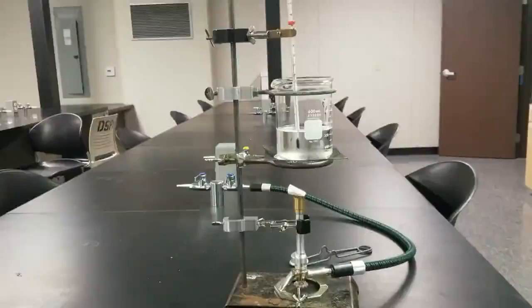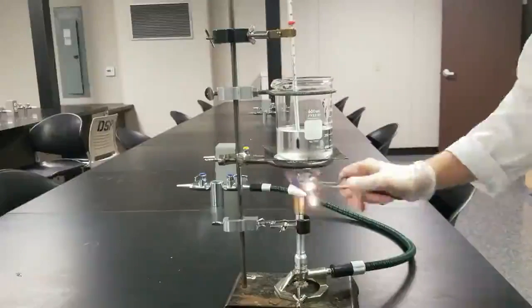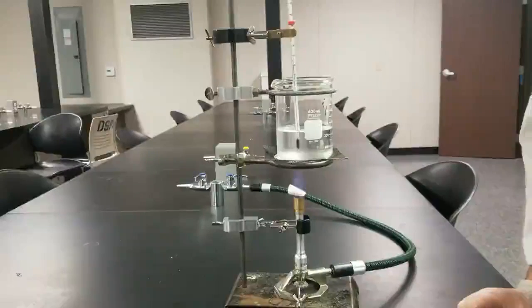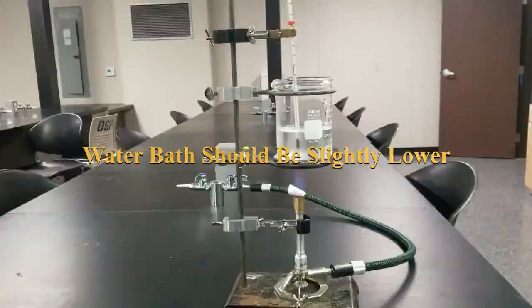Next up, we want to heat our water to a boil, and so we'll turn the gas on, use our striker to light our Bunsen burner, and then adjust the flame as necessary. This looks pretty good. We won't go for the tip of the inner cone this time because we want it to boil pretty gently.